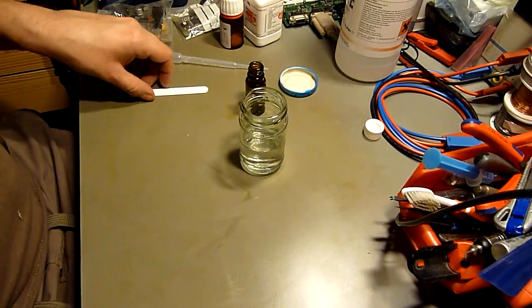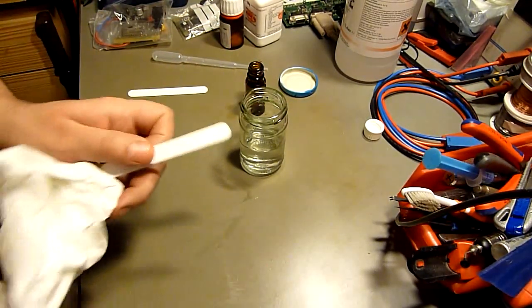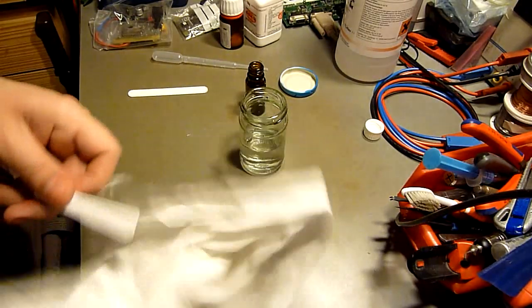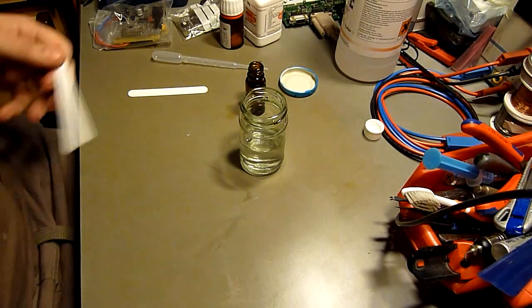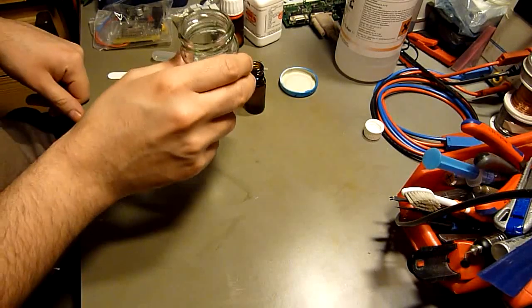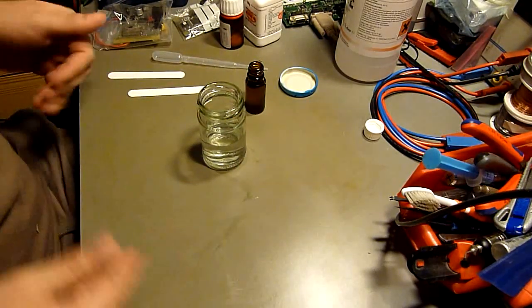Yeah boys and ghouls, I promised you an experiment about the silver coating of a PCB. My first results weren't so promising, so I'll show you again how this works—not again to you, but again to me, you know.